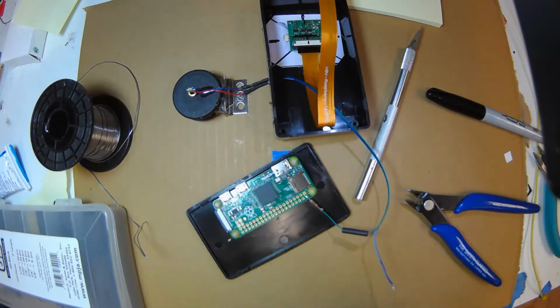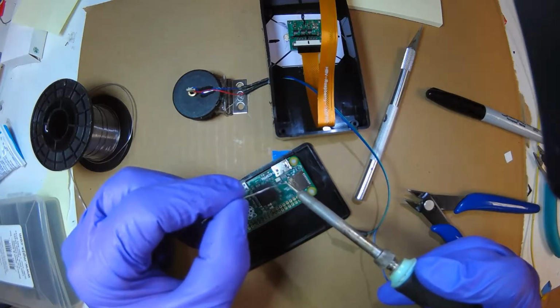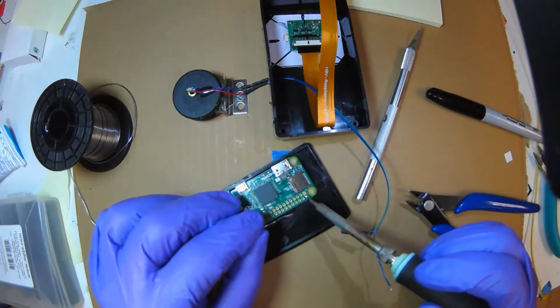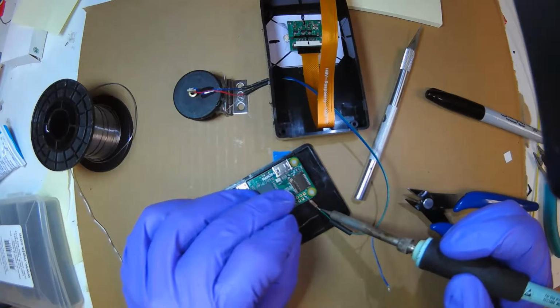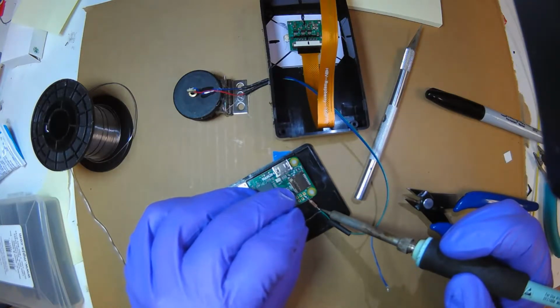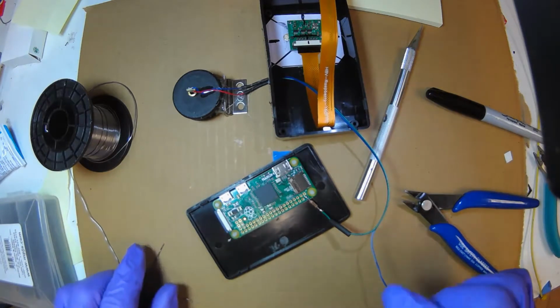The art of soldering, again, clean tip. I clean my tip. I put a little solder ball. So I have molten lead, which is conductive thermally. I'm going to put it on this joint here. Let the heat conduct for a little while. Then feed solder into the joint. Not on the iron, but the joint. The joint should be hot enough that it melts, and it does. Let go, let it cool down. And you really want it to cool down.